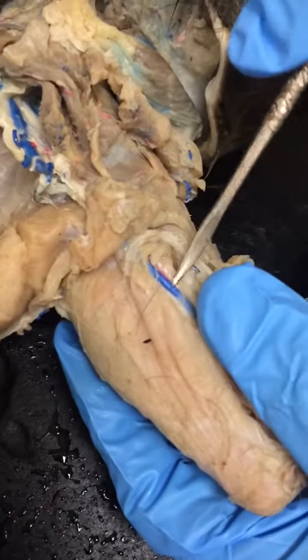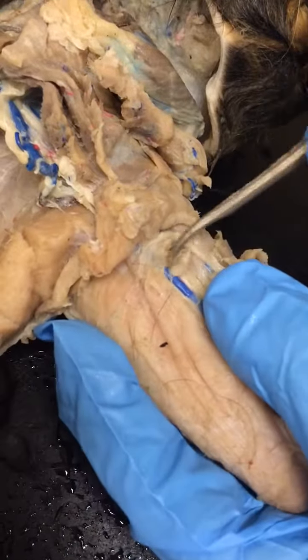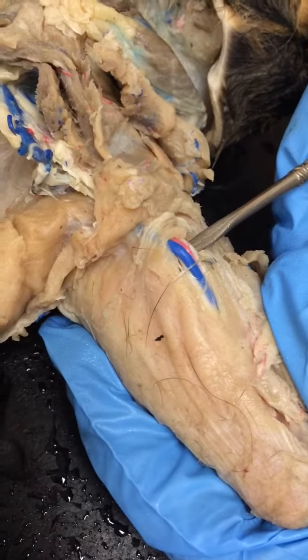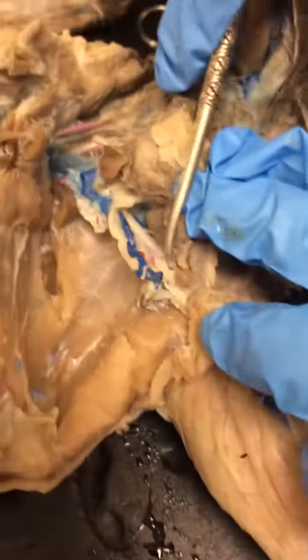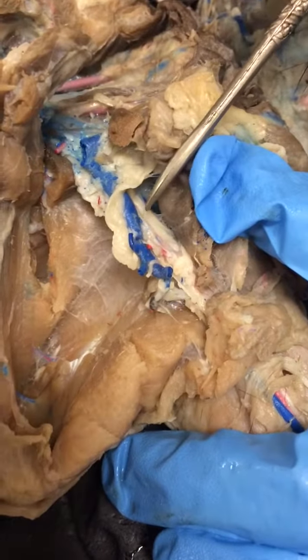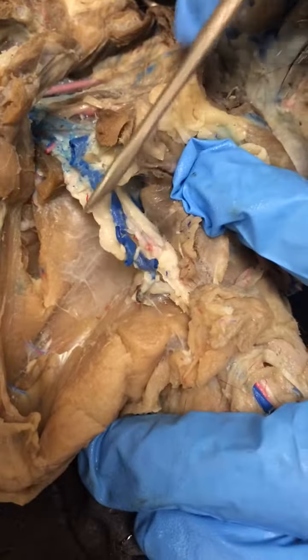Okay, so in the arm, right here, I'll just go and start it out. Ooh, nice. If we dig deeper in there, you can see the brachial vein in blue and the brachial artery in red. Okay, so you can see that in the brachial region. If we go in here, our cat's kind of messed up. But you can see here, I think this is the, not axillary, but subclavian vein and subclavian artery.